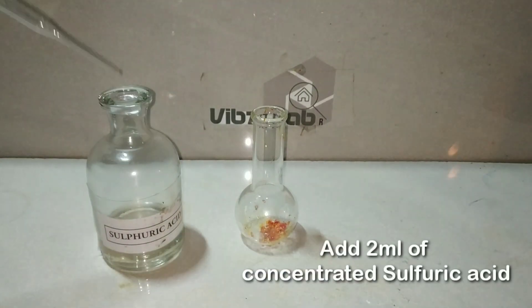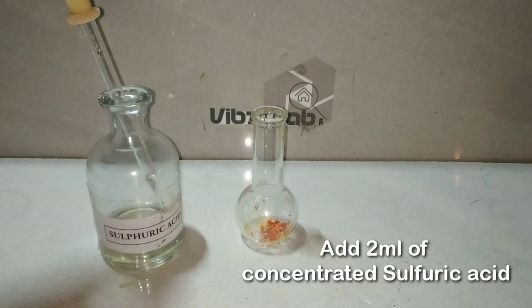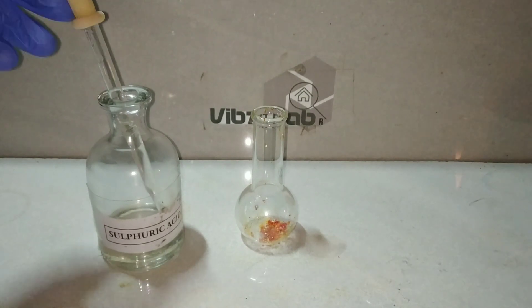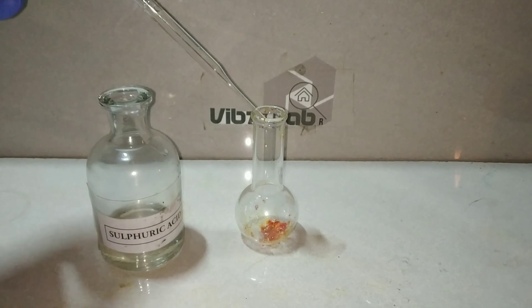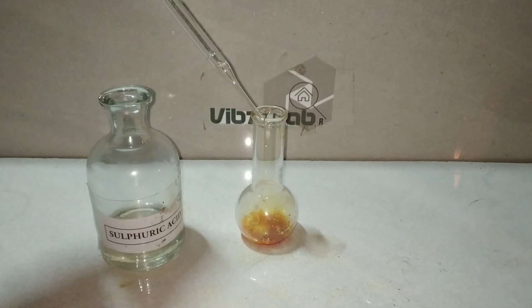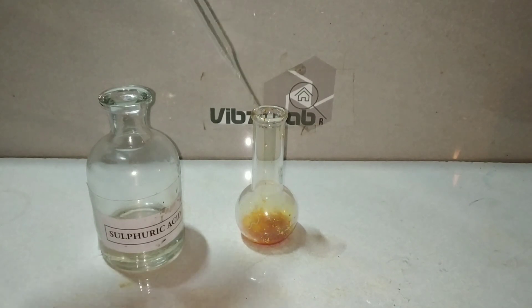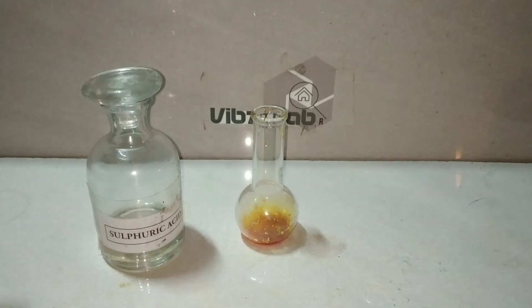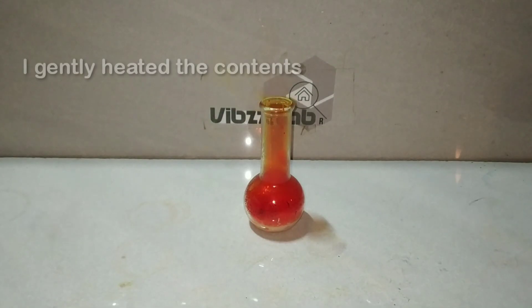Now we would be adding 2 milliliters of concentrated sulfuric acid into this mixture. Always be extra careful while handling concentrated sulfuric acid as it is corrosive. I am using a dropper to add the acid into the flask. Also try to keep the moisture level in the flask as minimum as possible.